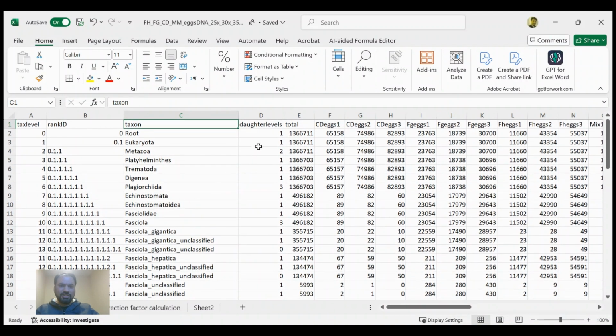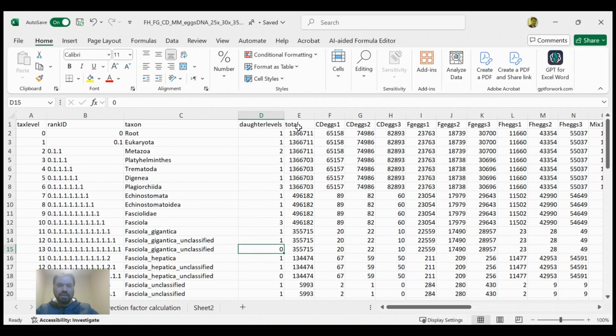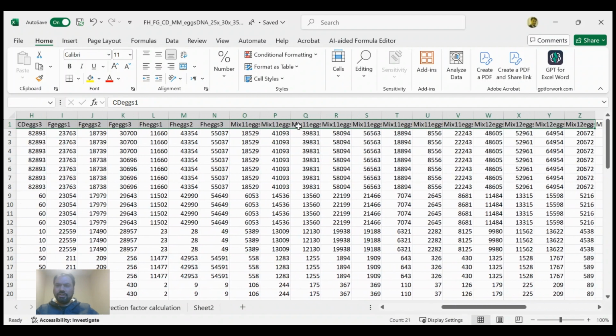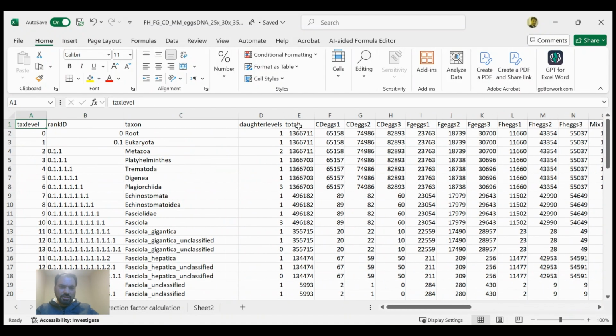And then you can see there is a daughter level, showing how your species daughter levels look, like daughter level 3 or 1 or 0. And then there is the total number of sequence reads, and in the next columns there are the samples which you ran during your MiSeq analysis on the Illumina MiSeq machine. These are the different samples that you have run, and these are my samples, which I will explain in the next slide.